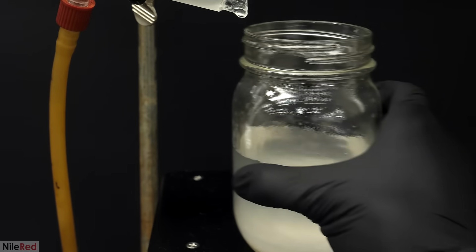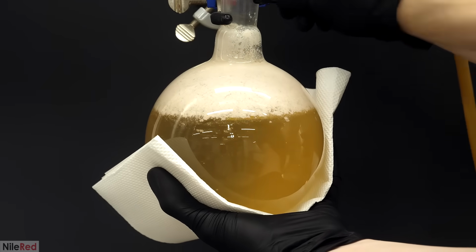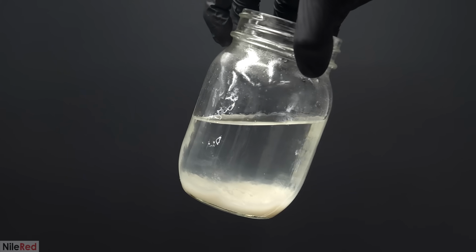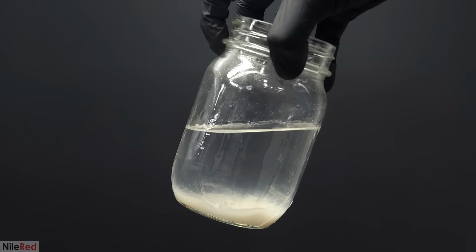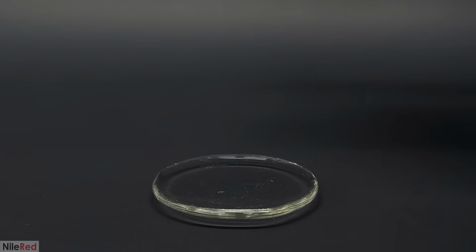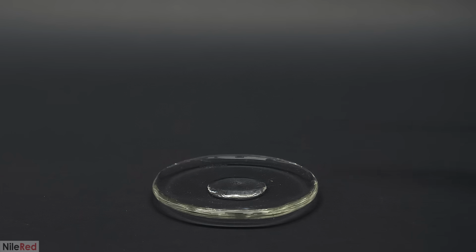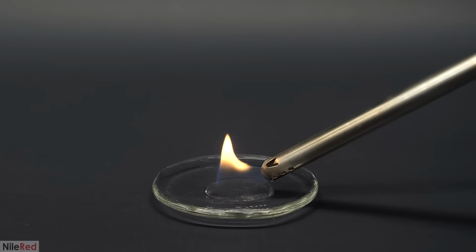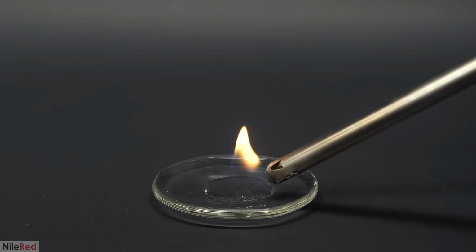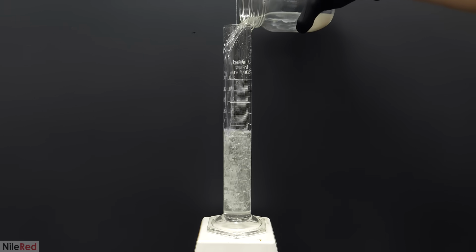At this point though, it was finally done, so I took away the mason jar and I dumped out all the stuff in the flask. What I had now was less than 10% of the volume that I started with, so it was way more concentrated than before. As a quick test, mostly just for fun, I decided to try lighting it on fire. However, it still wasn't concentrated enough to ignite, and not very much happened.